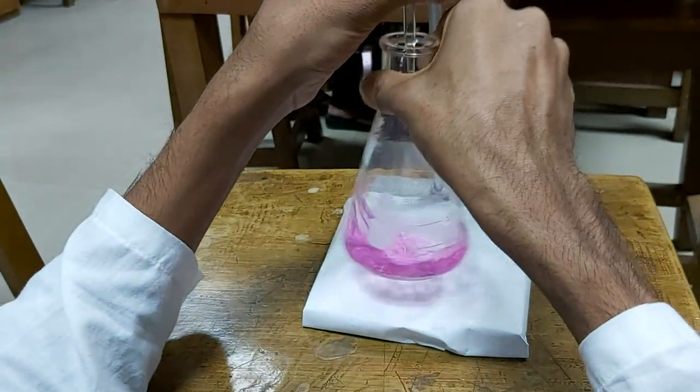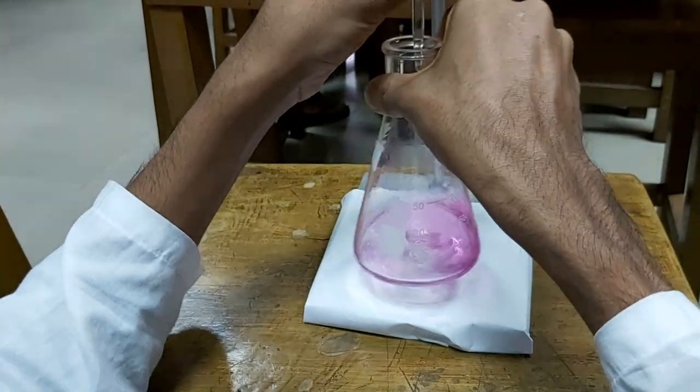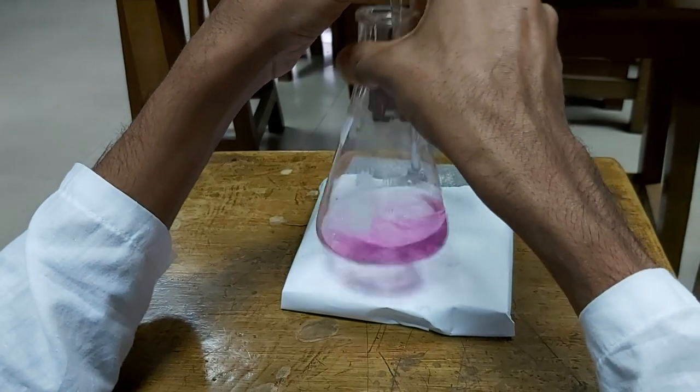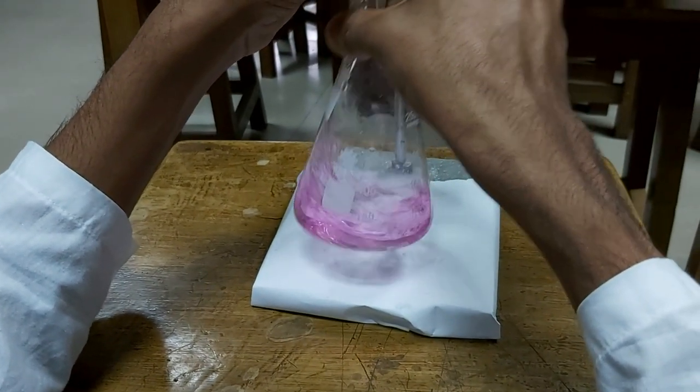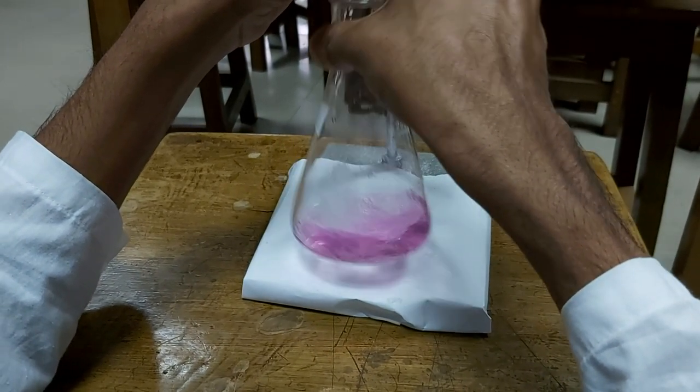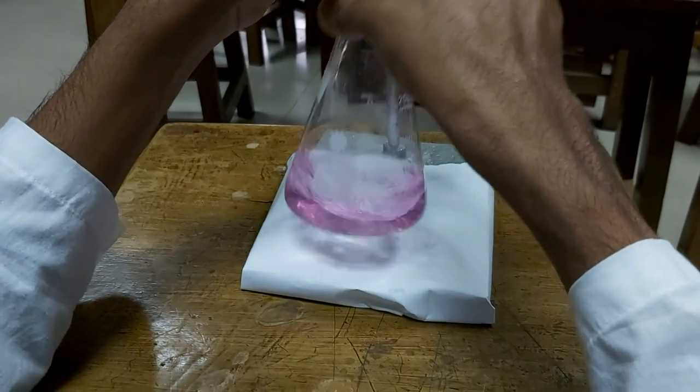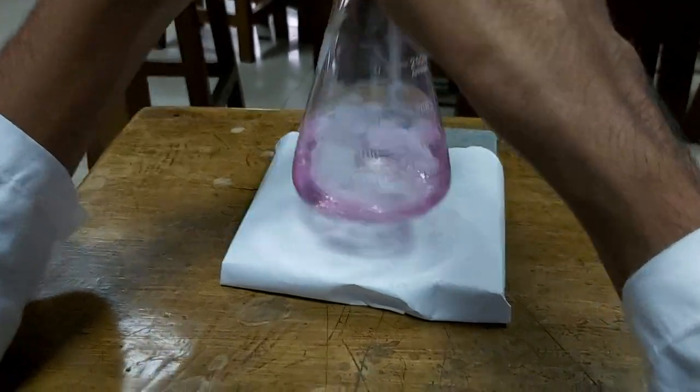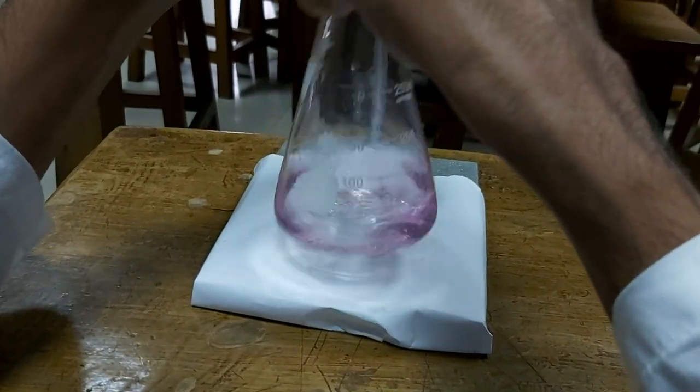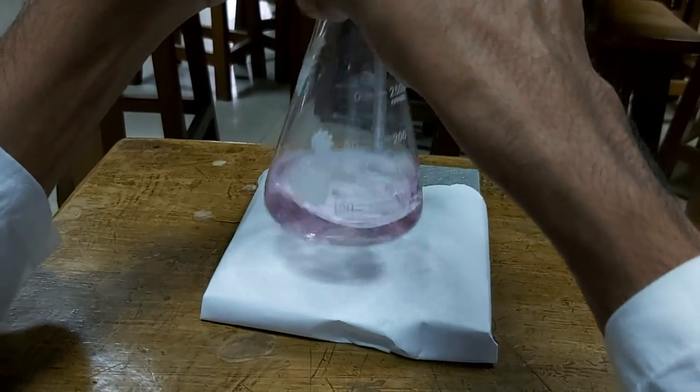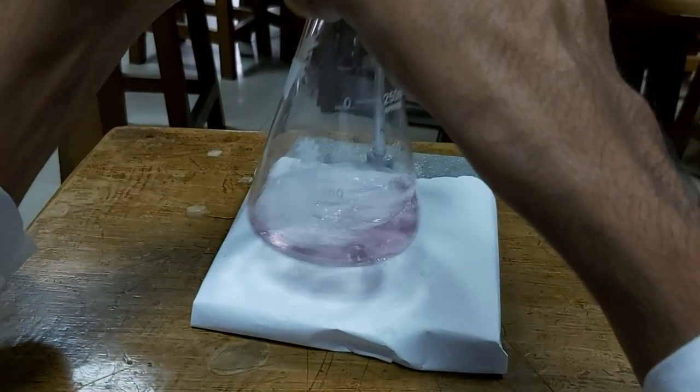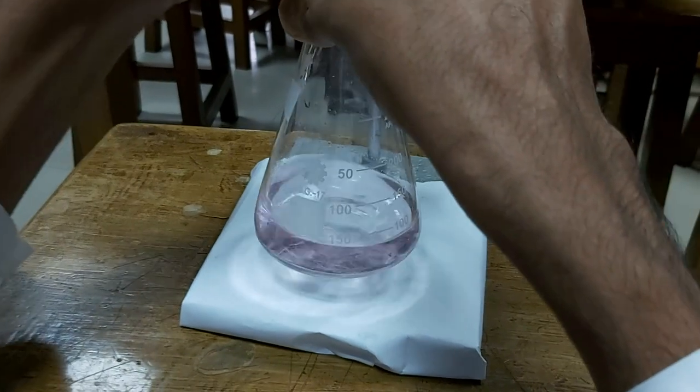Titrant is being added, and the color is gradually fading, indicating that the titration is approaching the endpoint. The color is getting more and more faded. When the solution becomes colorless, it reaches the endpoint.